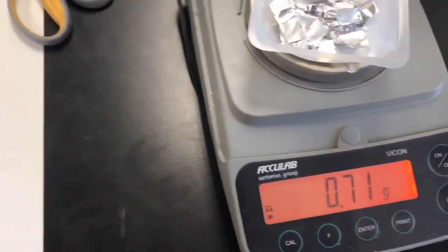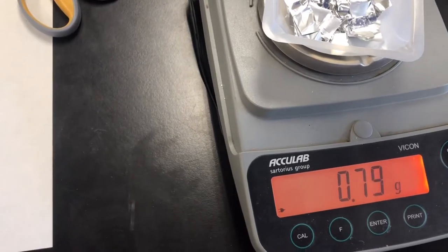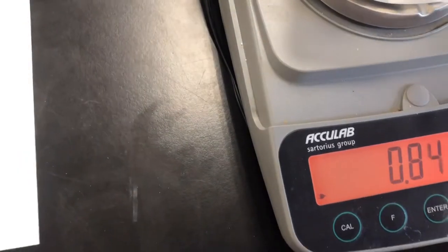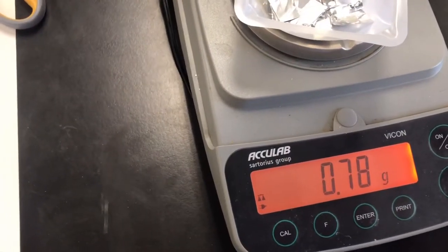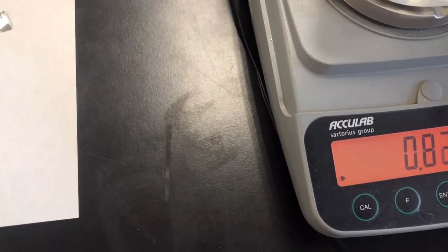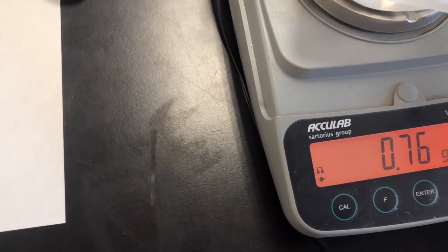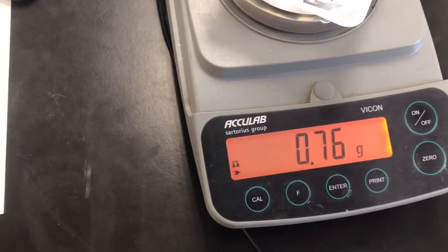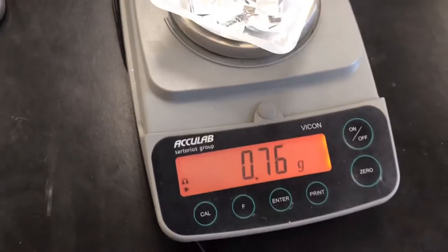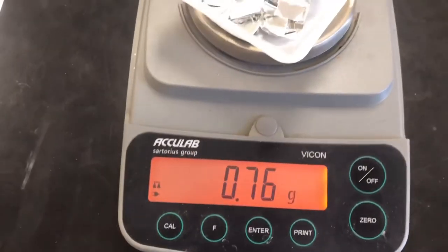There's 0.70. Let's see if I can get one more out of here. 0.78, 0.77. That's probably about as close as we're going to get. So we're going to record that as 0.76 grams.